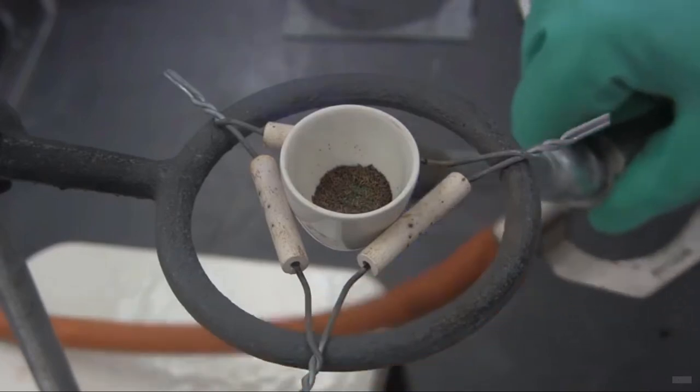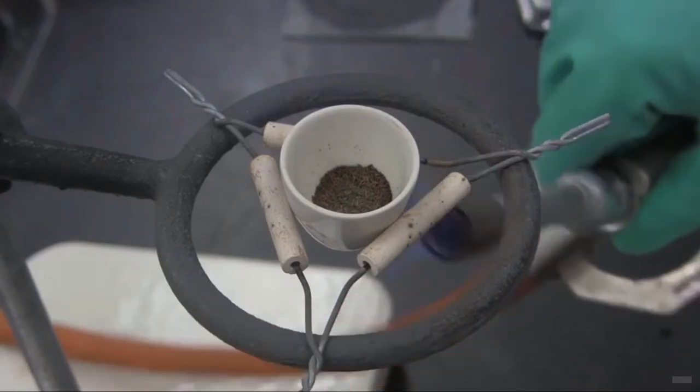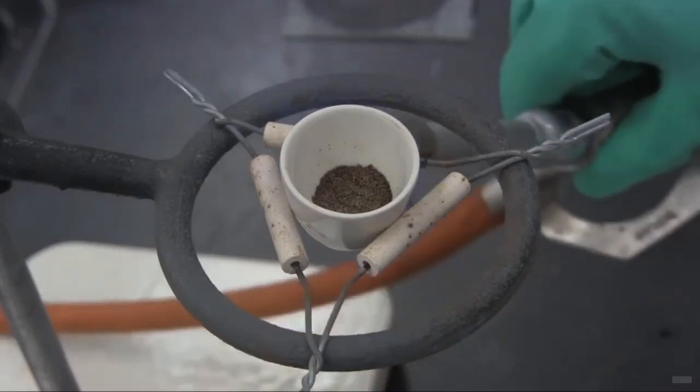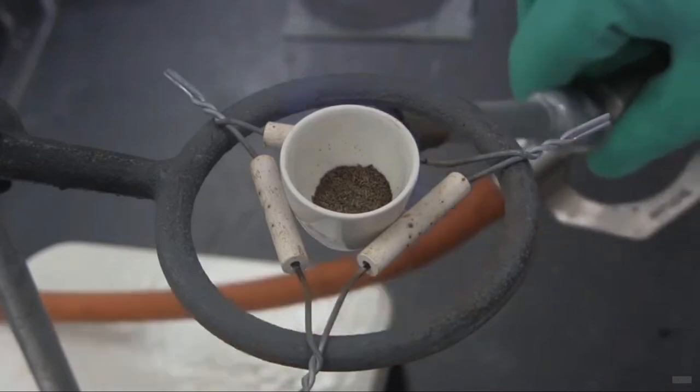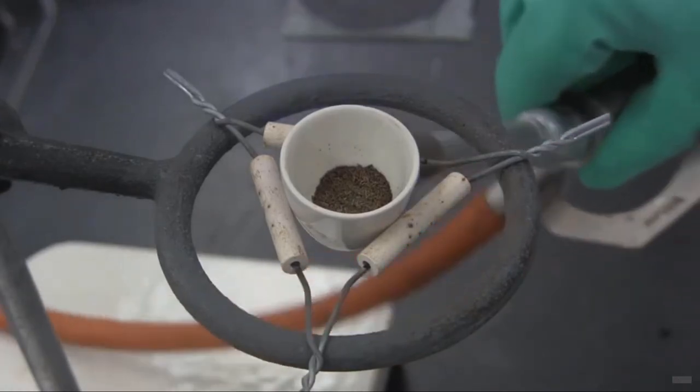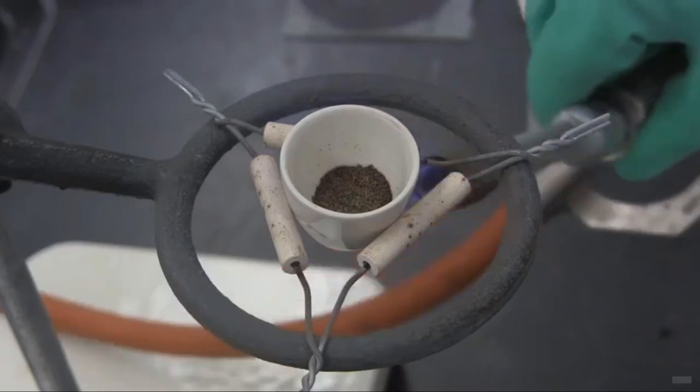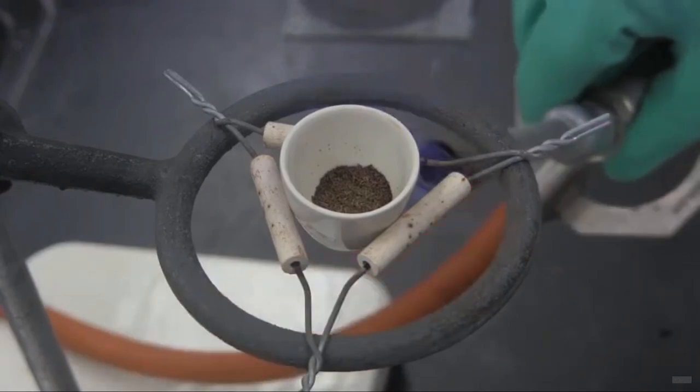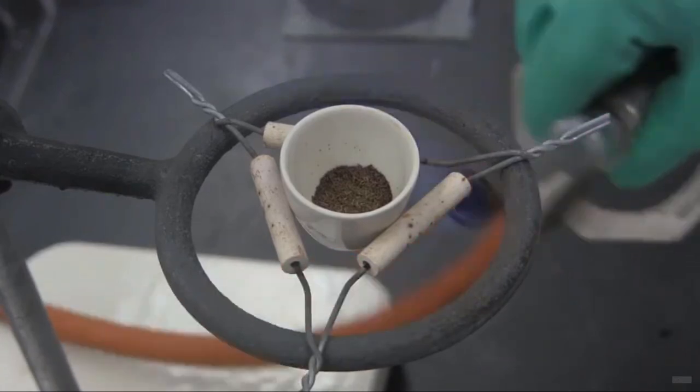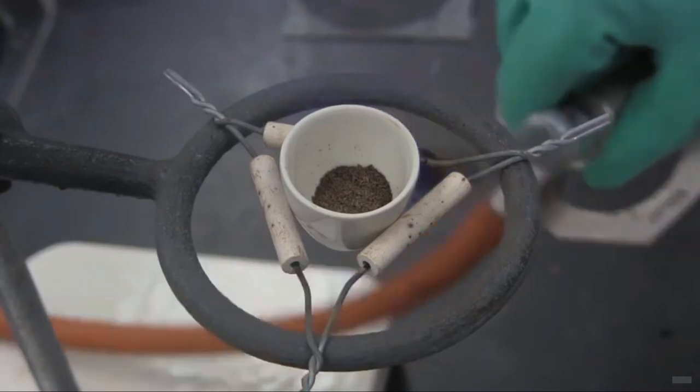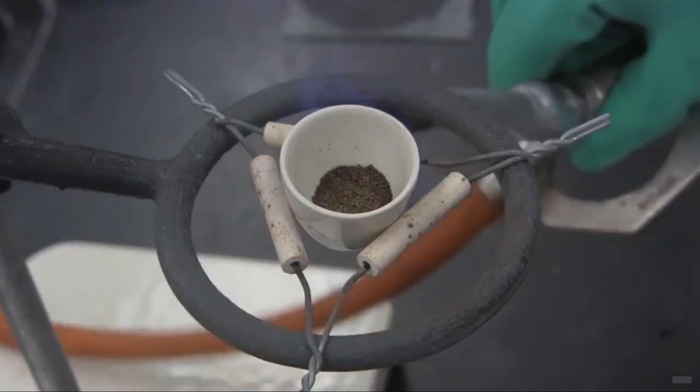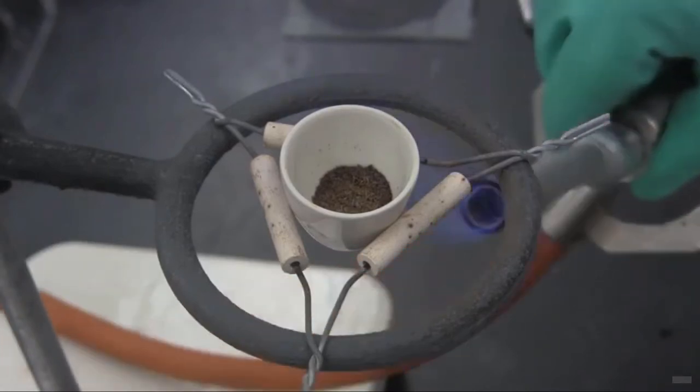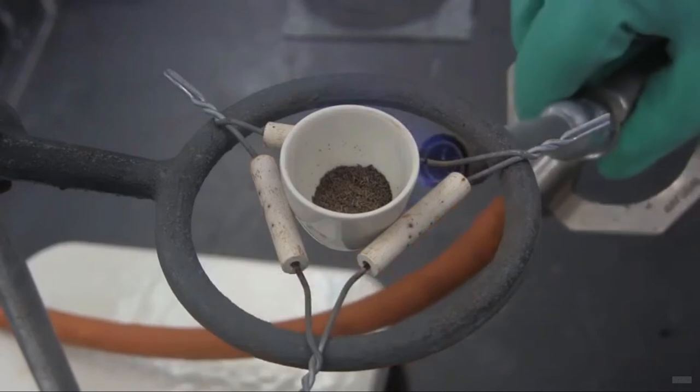There we go. Nice brown crystals. Now it's looking pretty good, but I still want to make sure that all of those crystals in there have turned to brown. And I want to get this right the first time. The last thing I want to do is cool this down, look at it, sort of roll it around and find out I've still got a bunch of green crystals in there. So I want to make sure I heat it enough, but not too much.